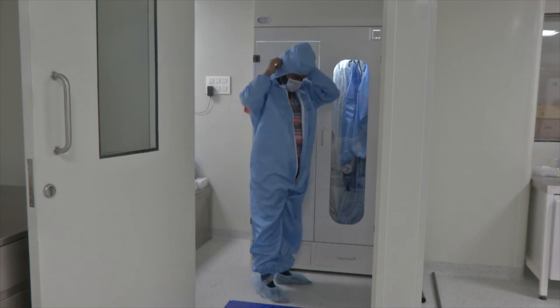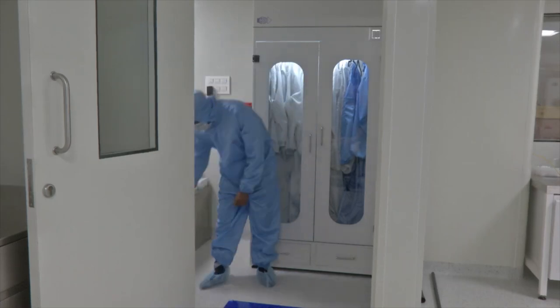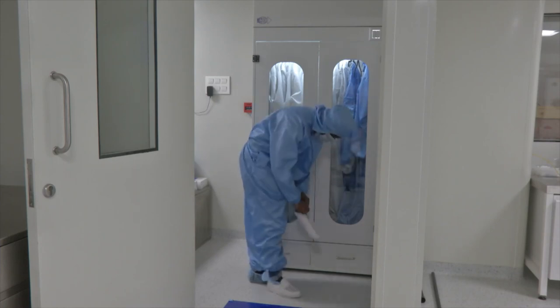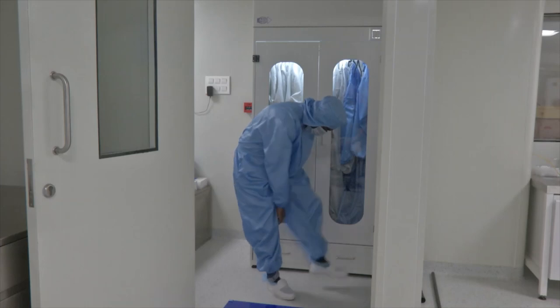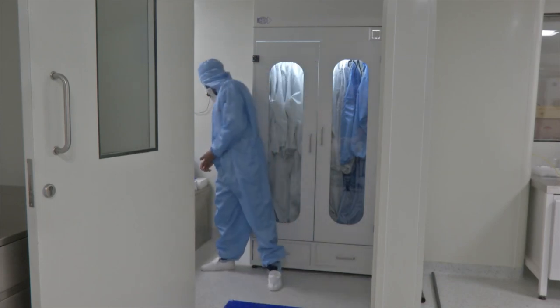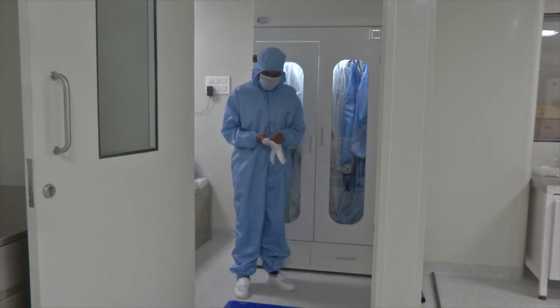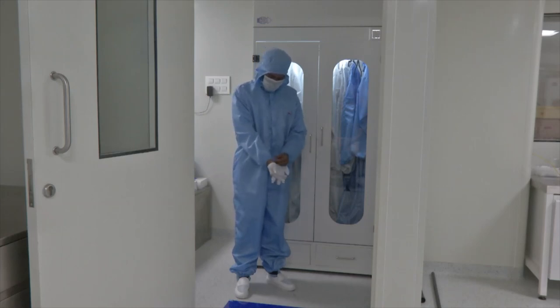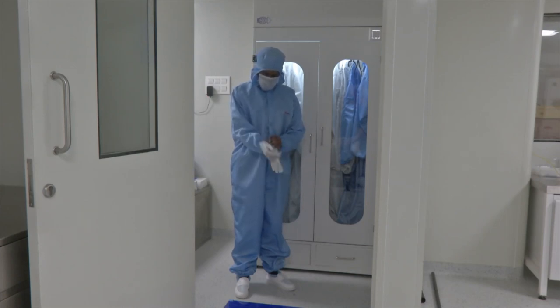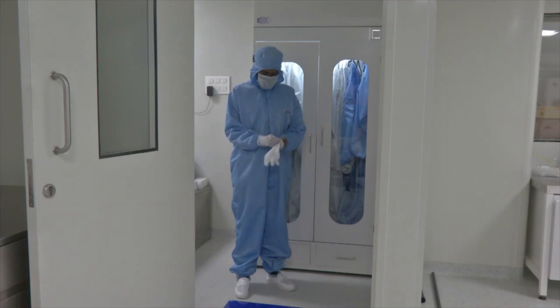There are special gloves of different types, though those are out of scope for this session. The primary protection layer for hands is latex gloves. Before wearing gloves, the required step is to wear clean room shoes — as you can see, my colleague is wearing static charge protected clean room shoes. The next step is to wear clean room gloves. These are nitrile gloves, resistant to weak chemicals, and can be used while working with solvents like acetone or IPA. They are powder free, meaning they do not generate any dust particles even when worn.